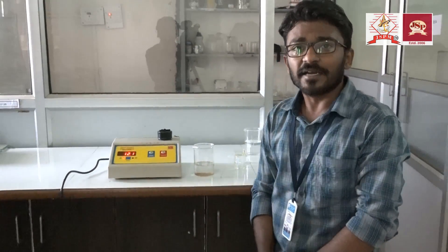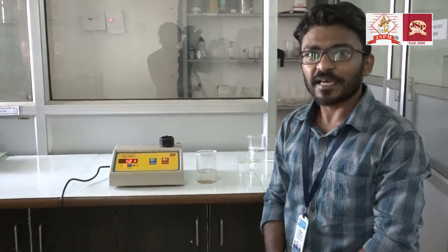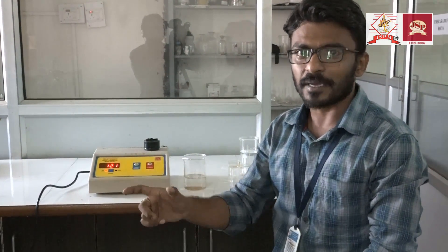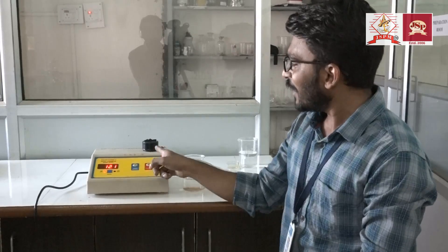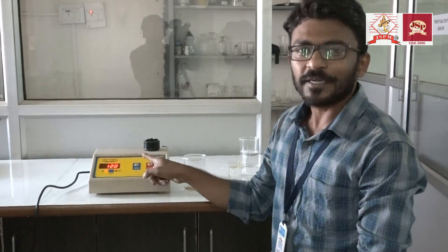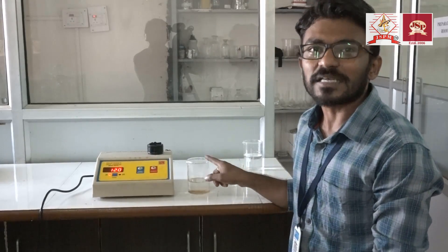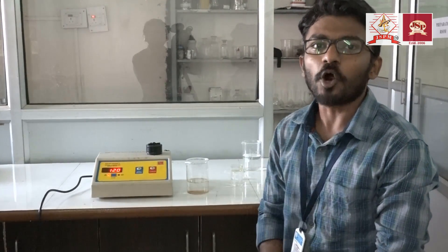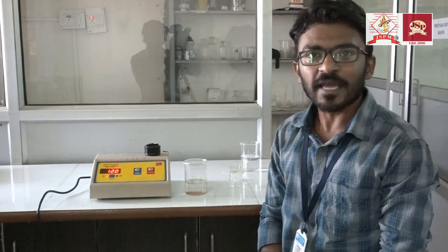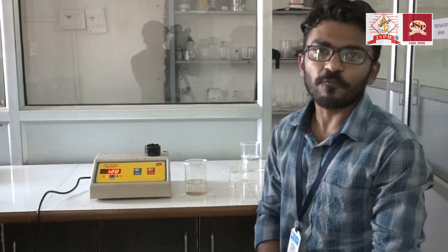As per IS standard, the range of turbidity should be between 5 to 10 PPM. But the given water sample has 12.1 PPM. That means this given water sample is not within the permitted limit. So we conclude that this water is unsafe for drinking.